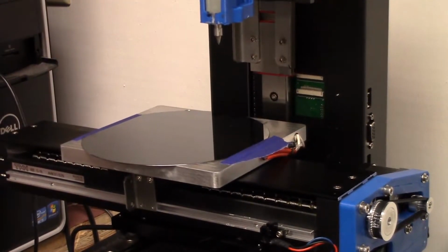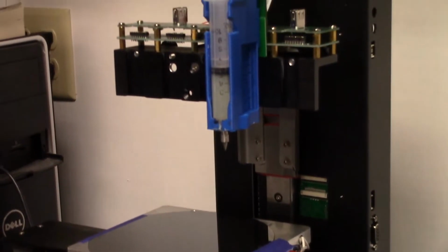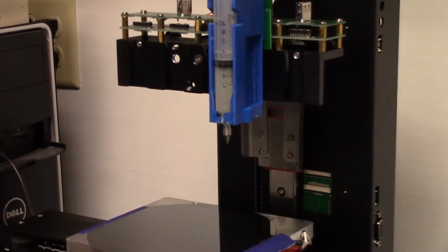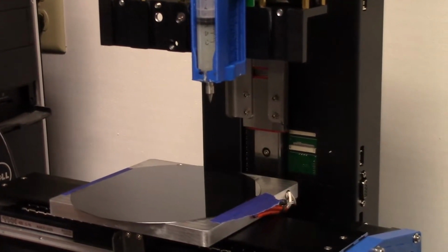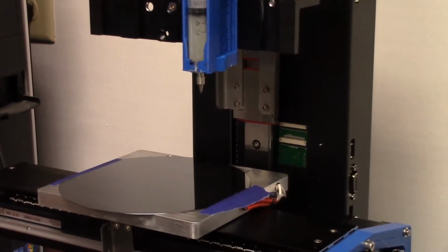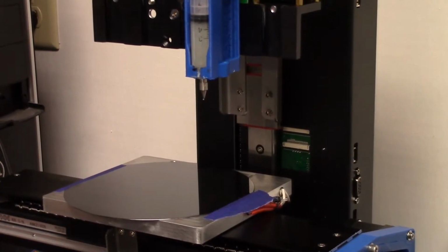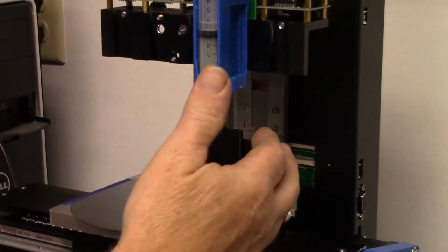It's spinning. We're just going to wait for it to start to give me some little string coming out of here. Sometimes when you load the syringe, it's a little bit larger opening, so it pulls the syringe open ever so slightly. And plus, that was the watchdog kicking in right there. We're starting to flow. Okay, now we got it. See the hair coming out?